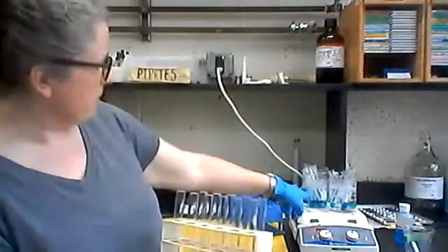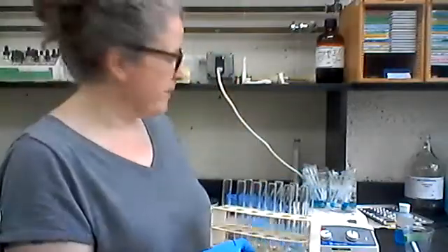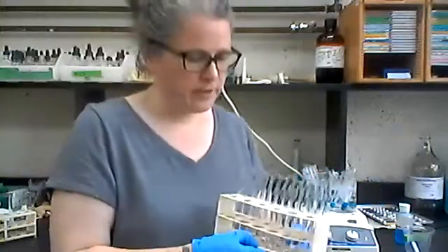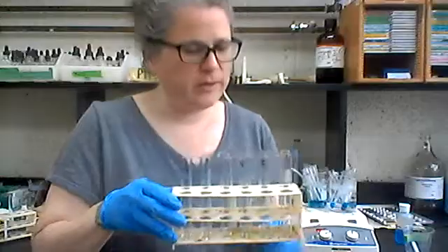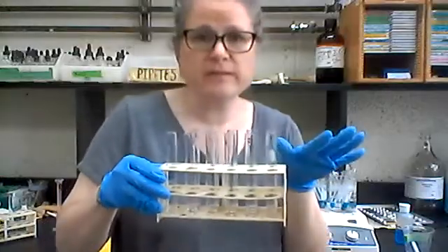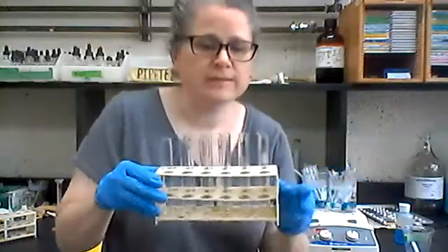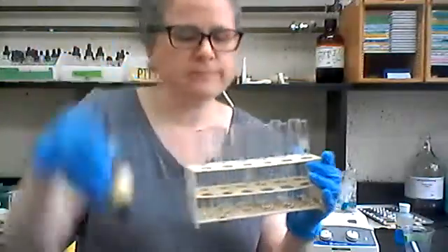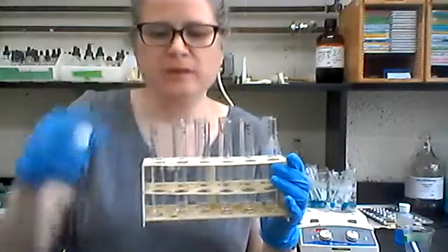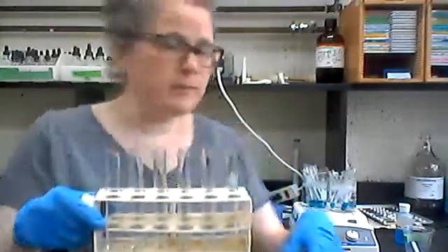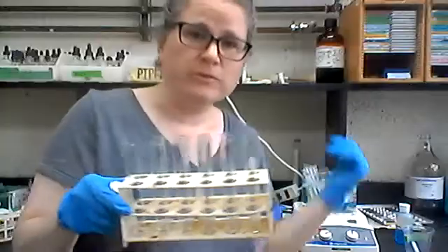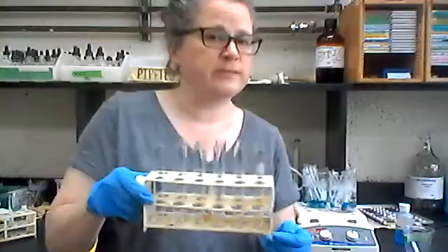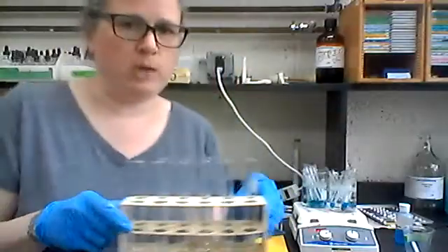Okay, so I've got those test tubes bubbling away, and they take 10 minutes in the hot water bath. So while they're cooking away there, I'm going to start the iodine experiment. Again, I've got those same 11 carbohydrates. This time, I'm just going to add one drop of this Lugol's iodine solution to each of them. I'll take some photos before I heat them, and then I'm going to heat them and take some photos after heating as well. This is to test for starches, those really complex carbohydrates.